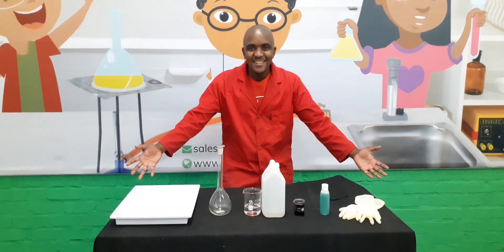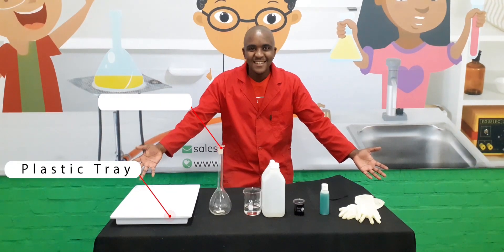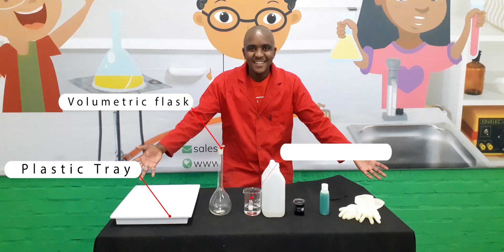The equipment we'll be using will be a plastic tray, a volumetric flask, and a glass beaker.